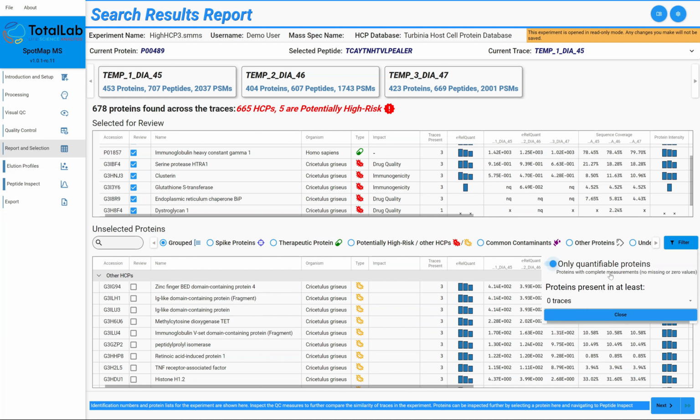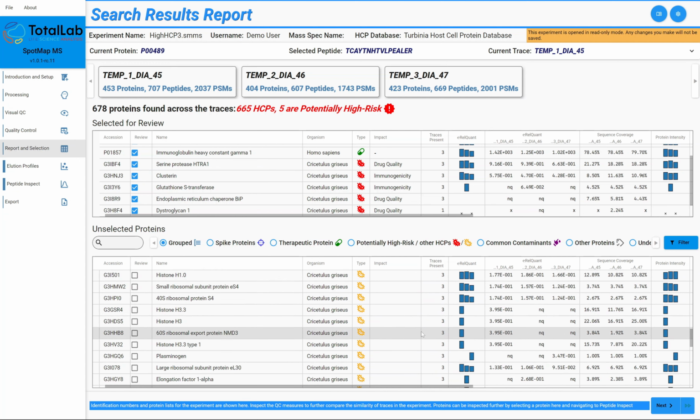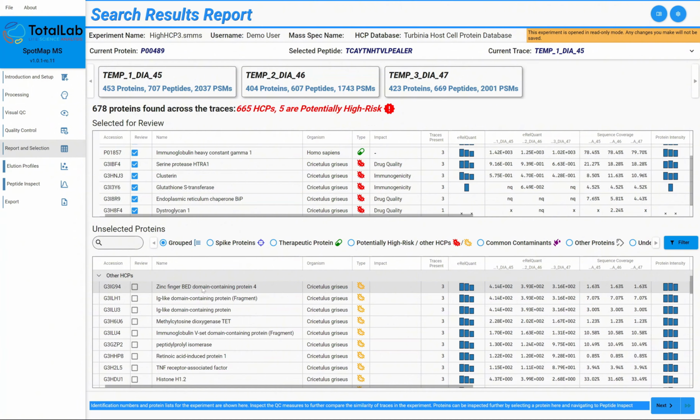What we can also do is automatically filter this list based on whether a protein is present in at least, so equal to or greater than, 1 trace, 2 traces, 3 traces. And we can add more to this if you have a unique workflow where maybe you're doing 5 replicates per sample, that kind of thing. But if I mark this as 2 traces, in my list now, I'll only see proteins that are present in at least 2 of my traces or all 3. So I can start to narrow down my list of host cell proteins very quickly.